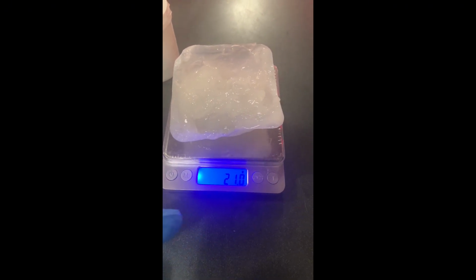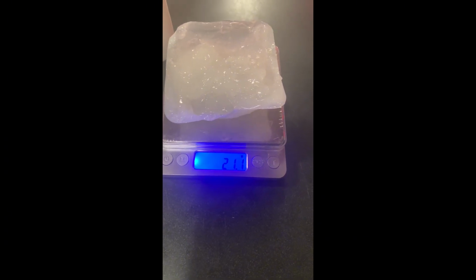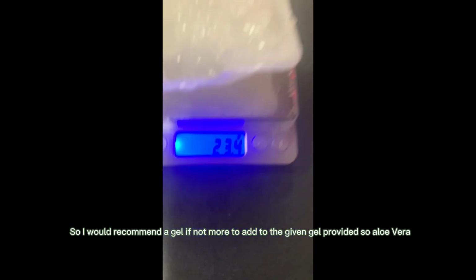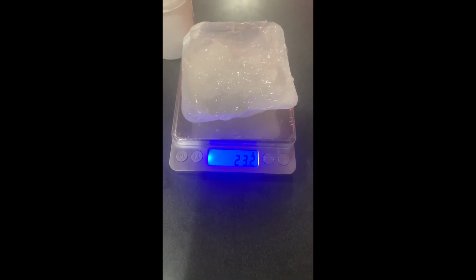So I do not have it, but hopefully this makes you understand that whenever you are doing this skill, you know, I put my weight to tare about 3 times on and off of camera, and there's still not enough gel. So it's literally empty. There's nothing in there. So yeah, this is what we have. The weighing scale keeps going up and down, and I've literally done this 3 times already.